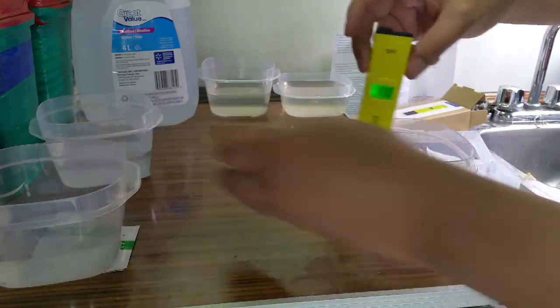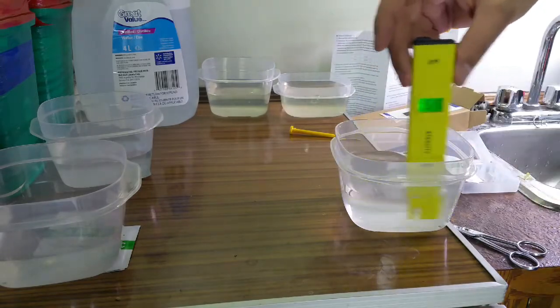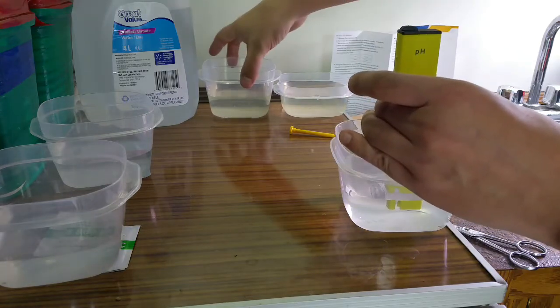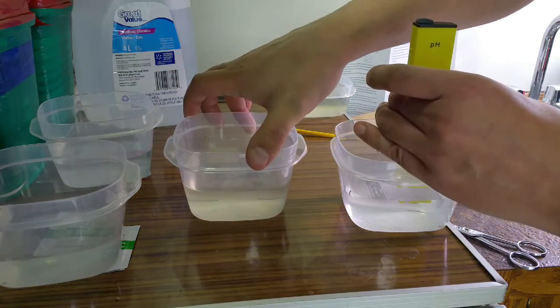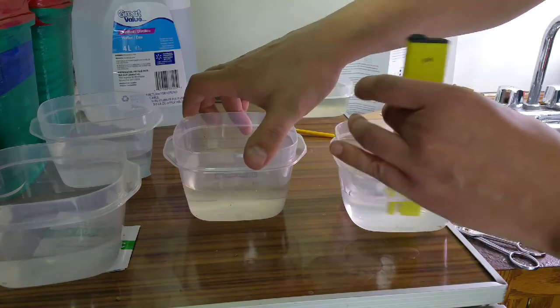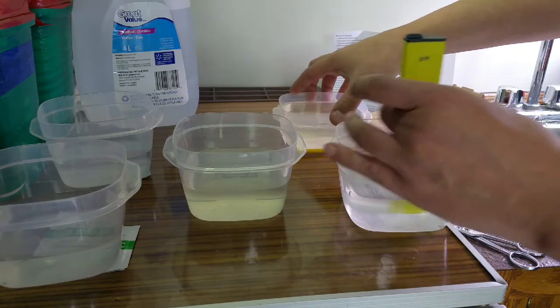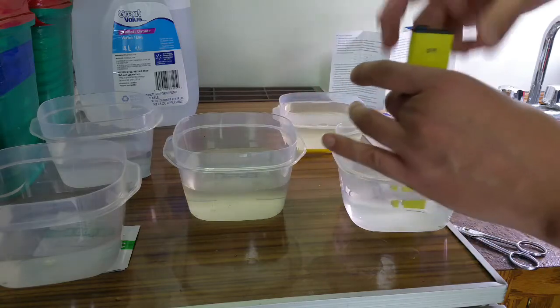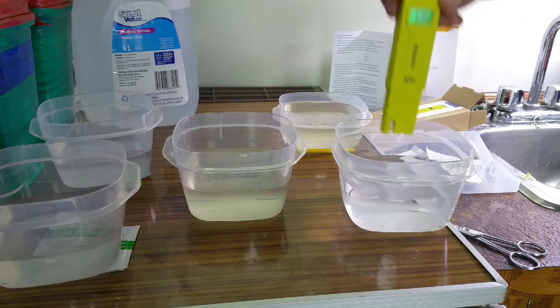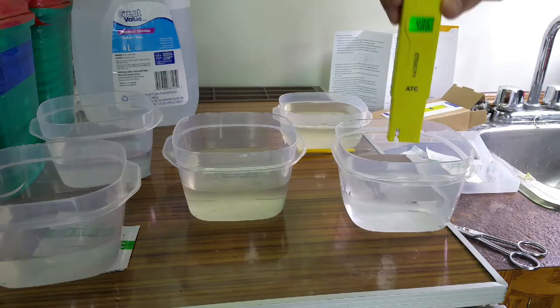So now that that's done, I'll push those buffer powders out of the way. I have a before and after on my AeroGarden water. I've never tested my AeroGarden water before. This is after two weeks when it's ready for nutrients. The nutrients light just came on today, so I pulled some water out. This is after I've added the nutrients. I didn't bother doing a water change this time, I just added nutrients. We'll see how AeroGarden's food deals with the pH. They say it balances its own pH.